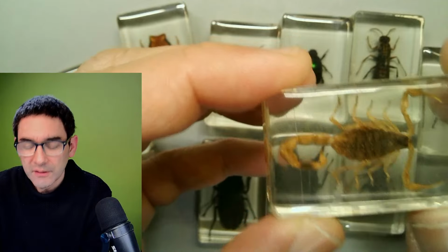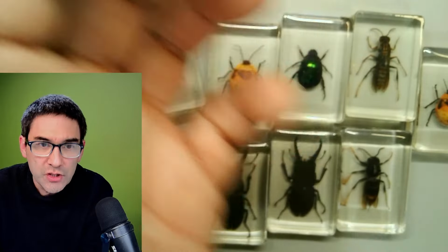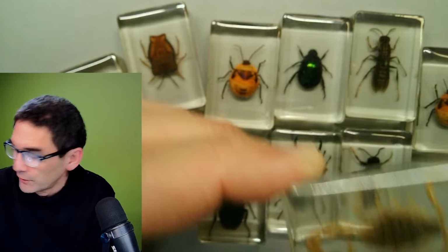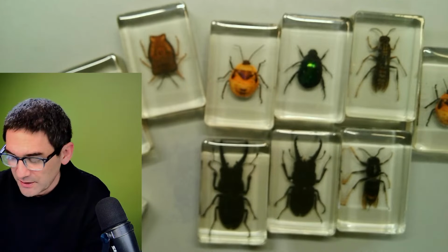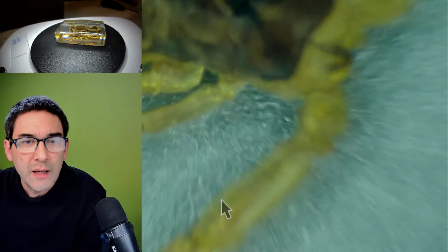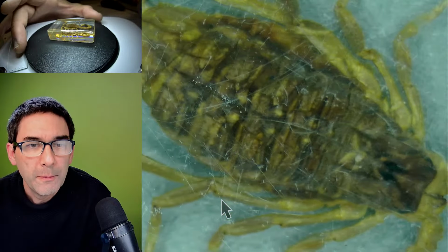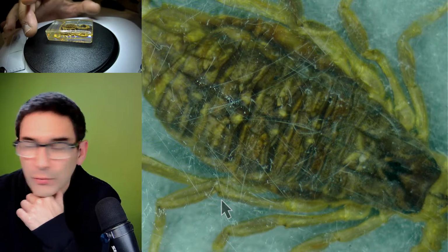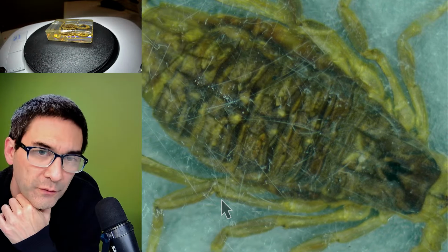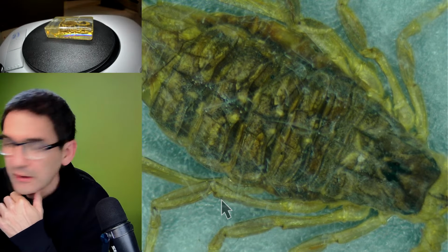But let's put this under the microscope, and I just want to show you some of the advantages and disadvantages. I'm going to wipe it clean a little bit, because there are, of course, tiny scratches on the surface, which are now visible as well. So it's now on the stereo microscope. Let's zoom out. So that is the scorpion with light coming from the top. And of course, you see those white scratches, but maybe they disappear if we focus a layer further down. The depth of field is quite large.